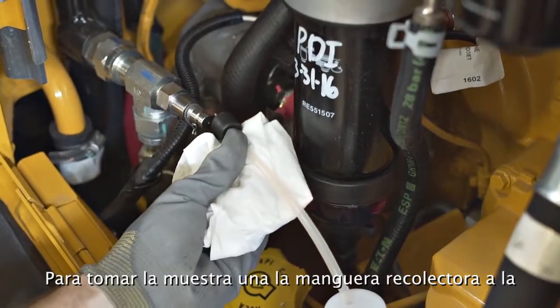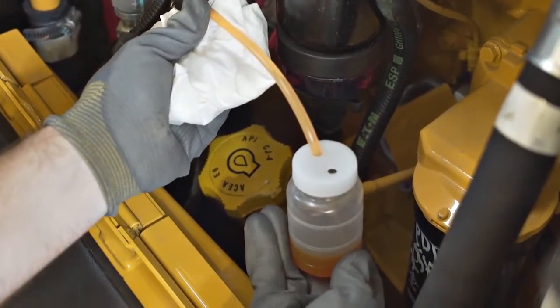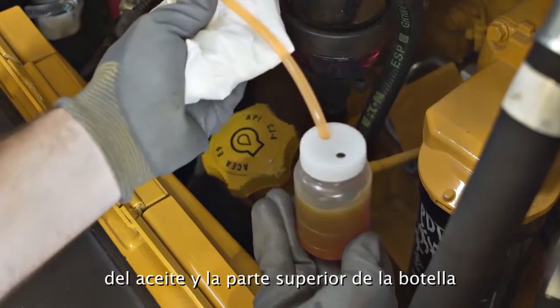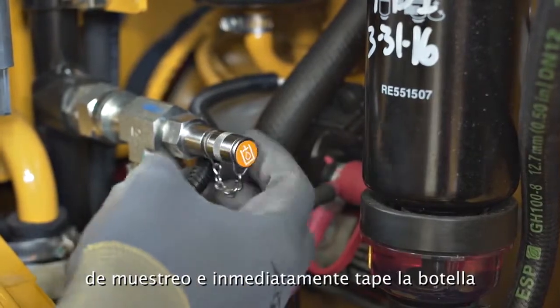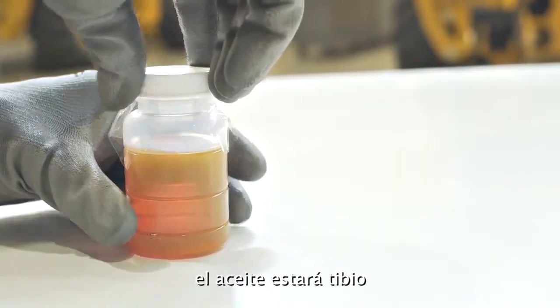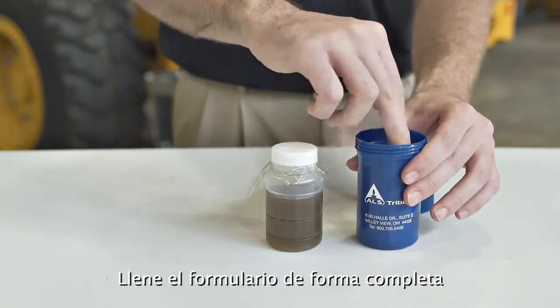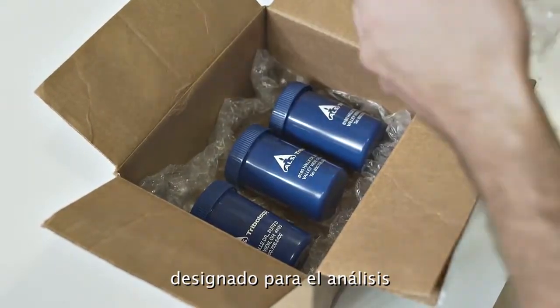To take the sample, press and hold the sample probe to the valve to release oil from the system into the sample bottle. Fill the oil sample bottle approximately 80% to 90% full. Leave some air space between the top of the fluid and the top of the bottle. Once a representative sample has been obtained, remove the probe tube from the sampling port and immediately seal the lid to the container. When properly performed, the oil sample will be warm, indicating that a representative sample has been obtained and all stagnant fluid was removed during the purge process.